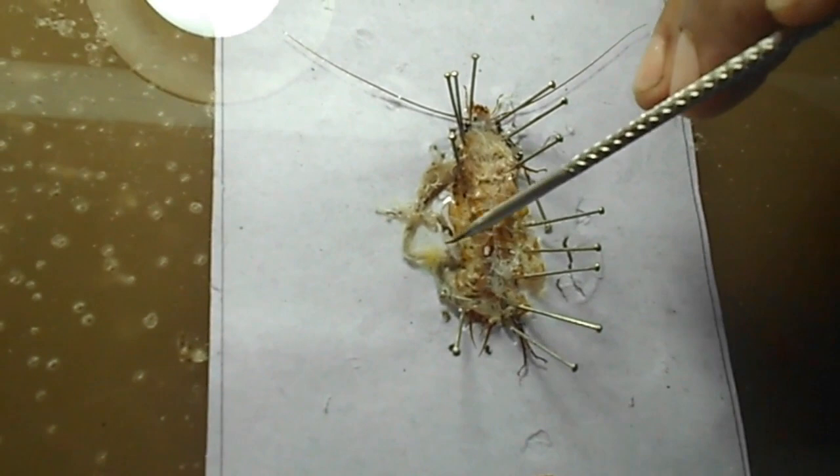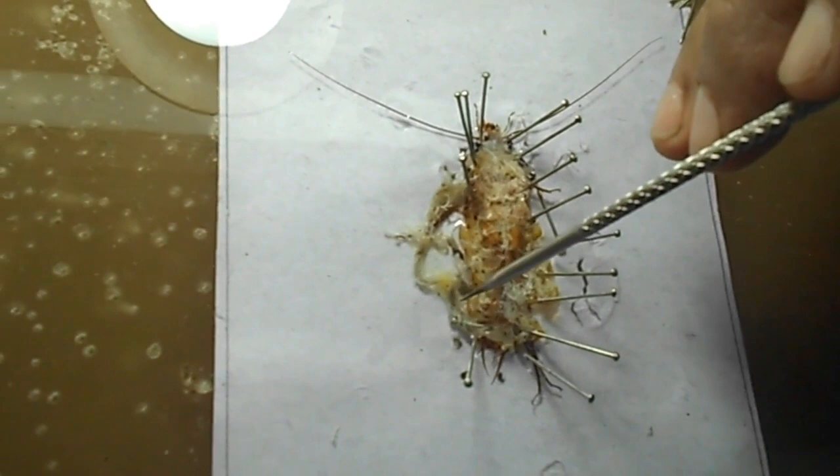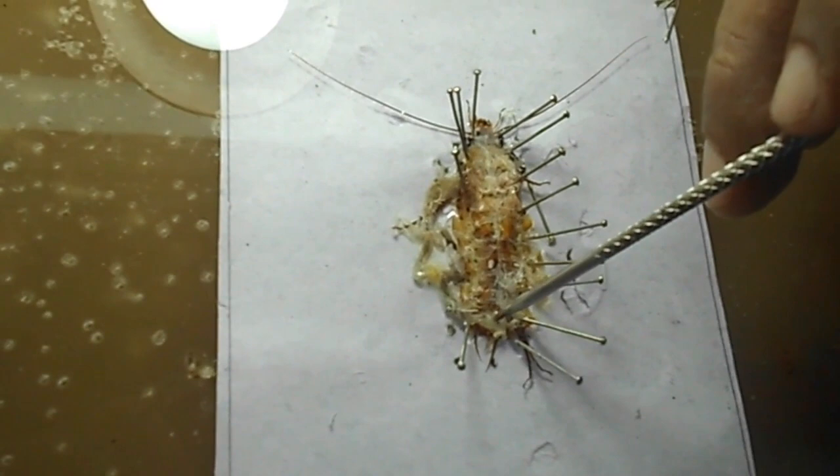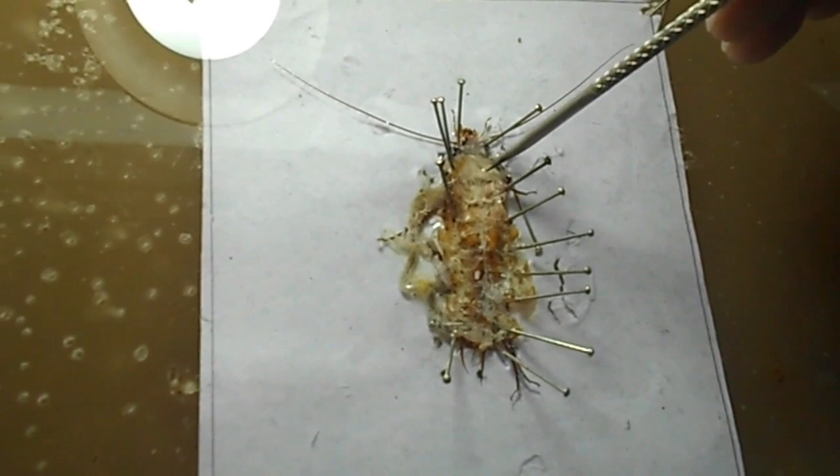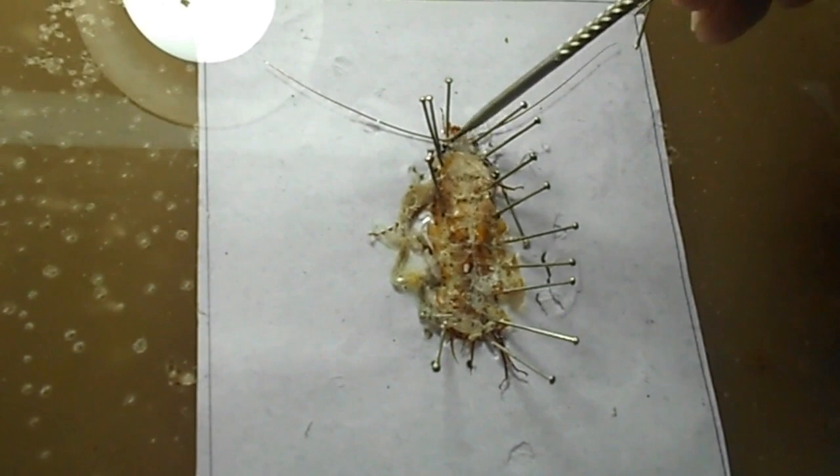After the Malpighian tubules, this structure is called the hindgut, that means it is the ileum. This is the anal aperture, and this is the rectum. Here we see this white color structure called the salivary apparatus — the salivary gland and salivary reservoir — present in the thoracic region. So this is all about the digestive system.